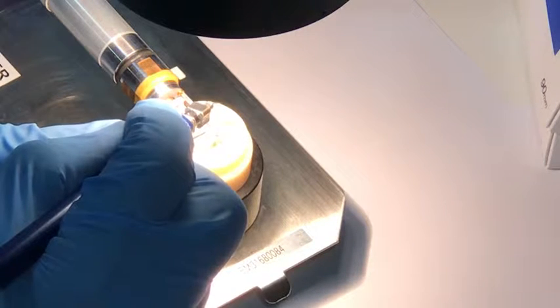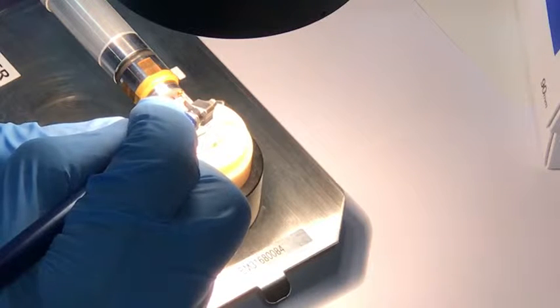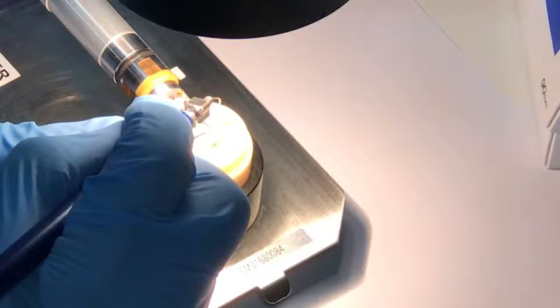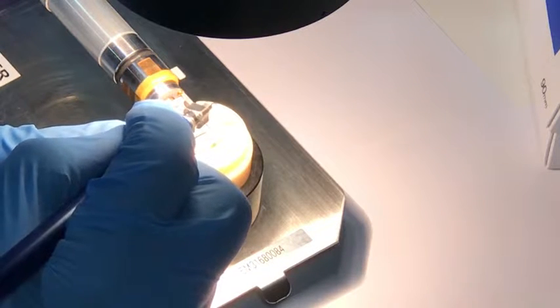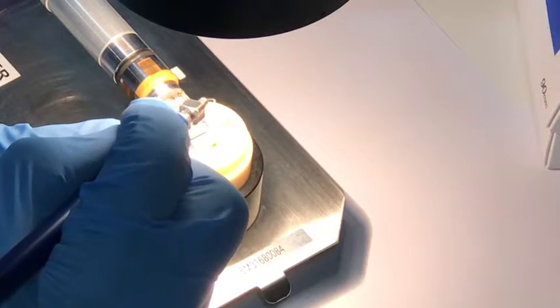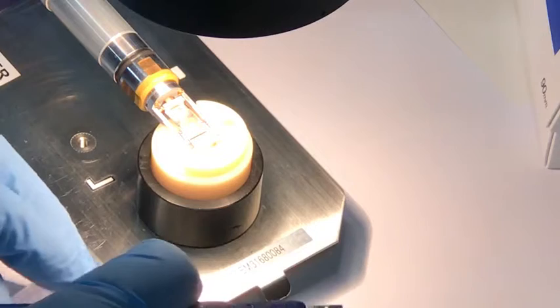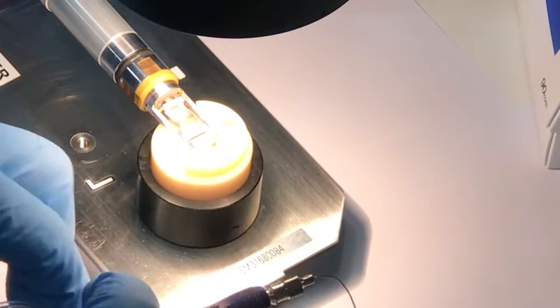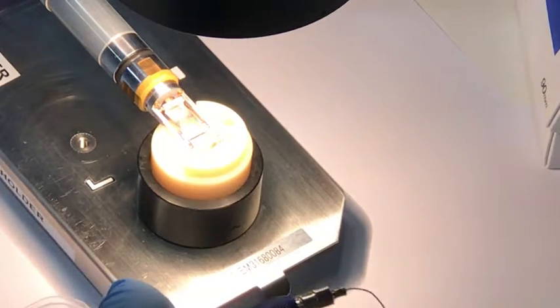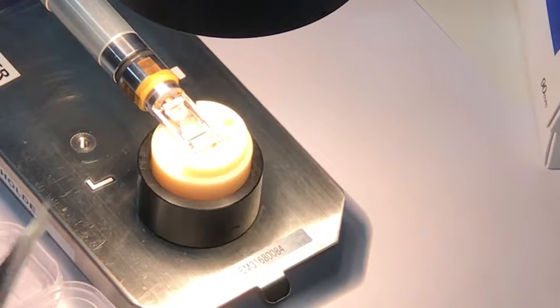Come on, nice. This little copper bracket has fallen in the wrong direction, not the direction I want, so I have to just leave it there. Now to put this back in the membrane box, this might be out of the field of view, but this is a little membrane box in which the specimen sits.